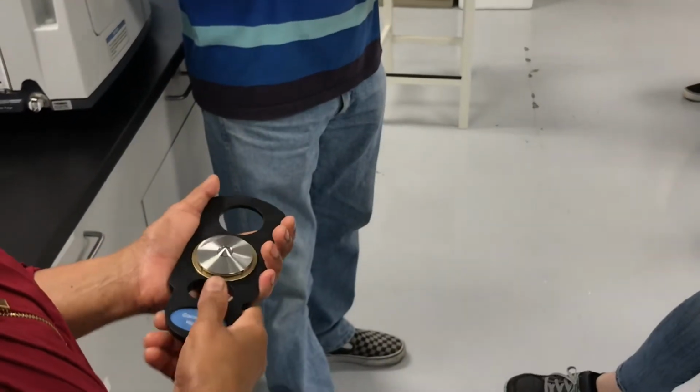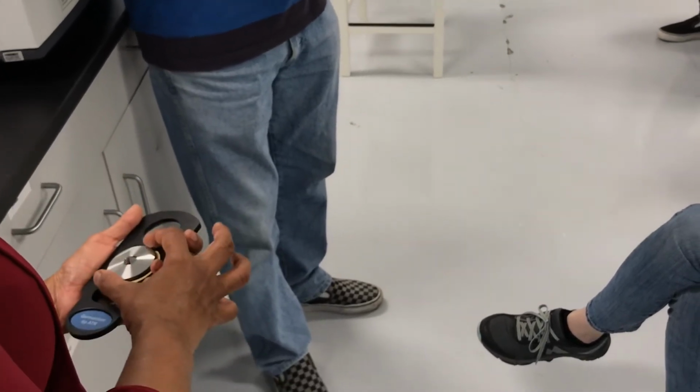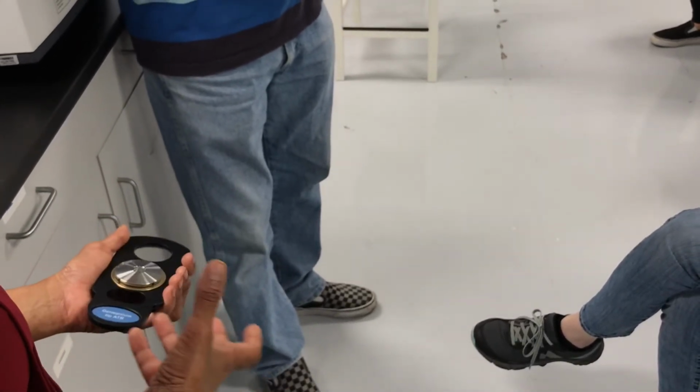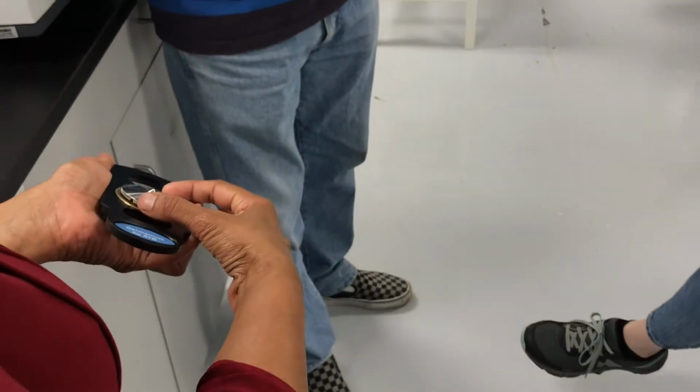But over time, folks may be thinking of something else, and sometimes it gets loose or something happens to it. You do get 2 alignment screws that is like this, and it's very straightforward to do the alignment as well. But if you break this, you will just order this part.